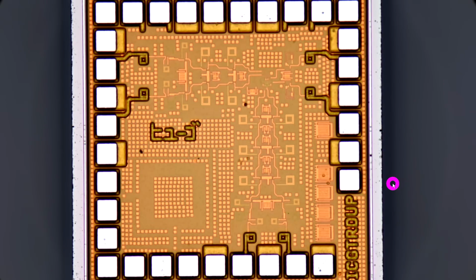So as a result, even at a 10x magnification of the lens, which is 100x overall, I can't get all the layers of this chip to be in focus at the same time, because we're spanning 10 or 15 micron, and that is beyond the depth of field of this particular lens.